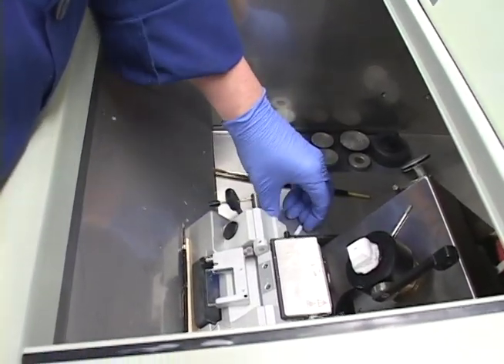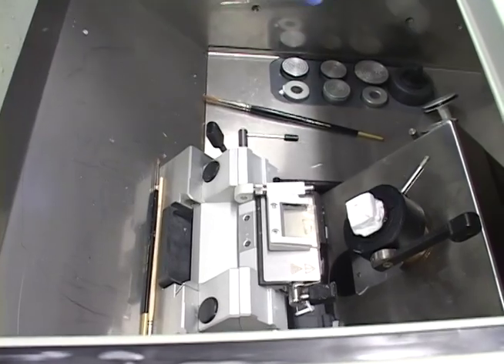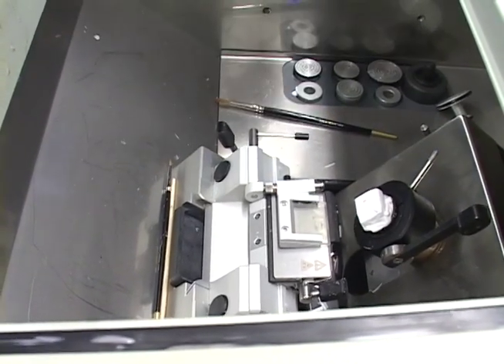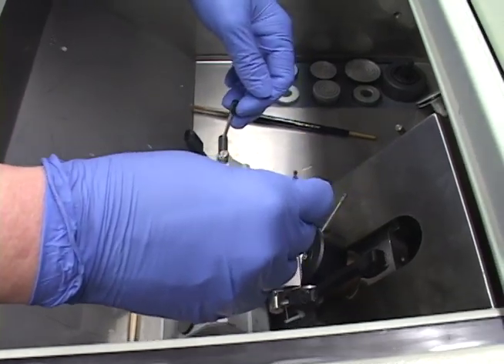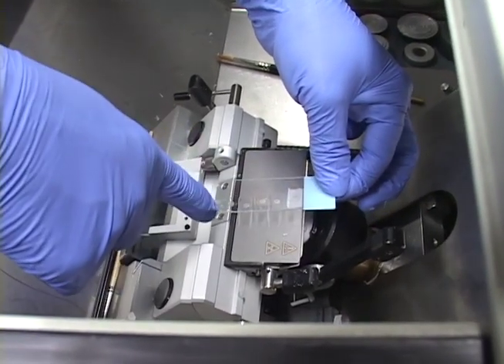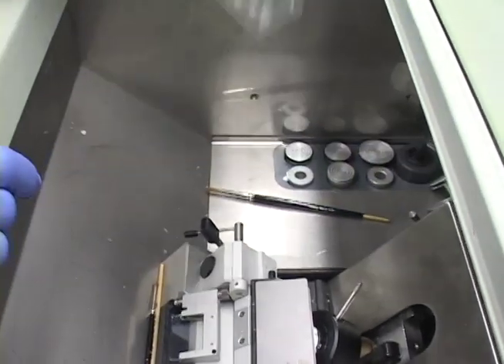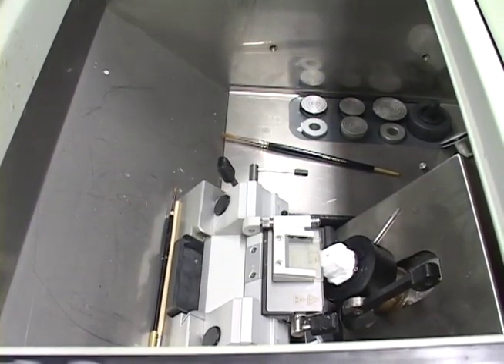Let's show the roll plate again. The roll plate we adjusted — I made that look easy. Sometimes as you're cutting it gets a slight bit off. Just slide it one way and if it doesn't work, go back the other way. The roll plate is the easiest way if you have one. I don't want these other sections I just cut to be touching the cold plate — it's kind of like sticking your tongue on a telephone pole; it ruins your first layer.